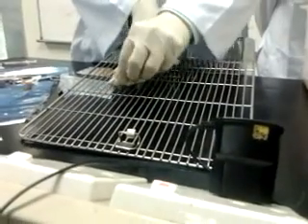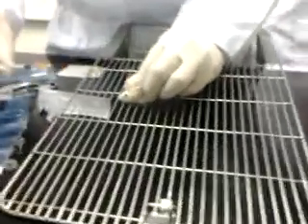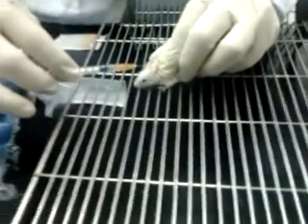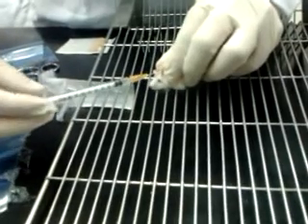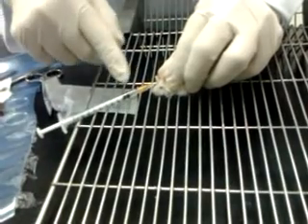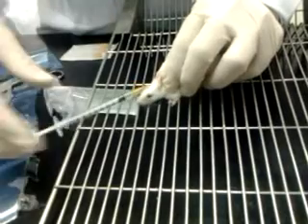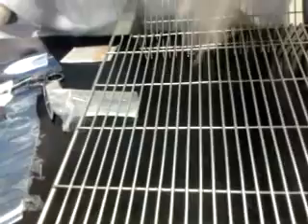I'm going to hold it here, scoop down. You can see a loose skin. The needle must be bevel face up. I place it in between my fingers and insert into the skin. Okay, I pull back. There's no air bubble. When I pull the plunger, you can see the plunger go back. That means it's under the subcut. I put in this 0.1. Okay, subcutaneous under the loose skin. We leave it there.